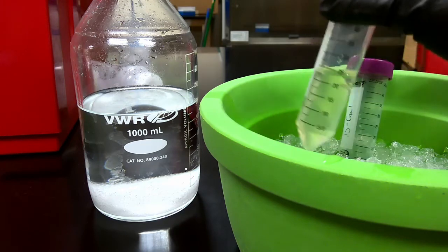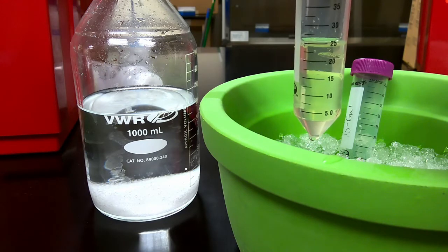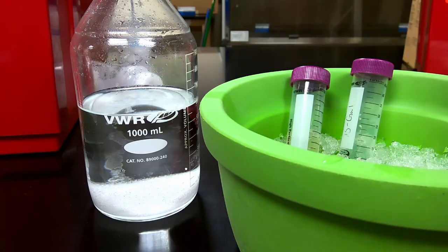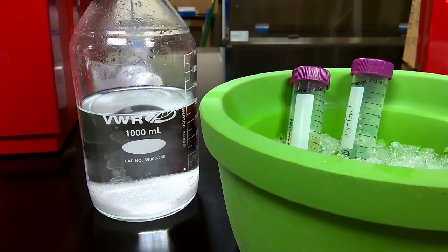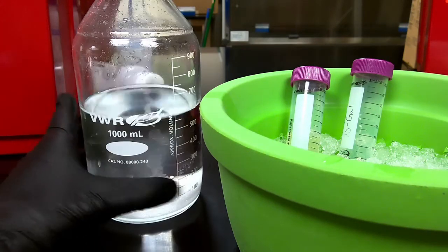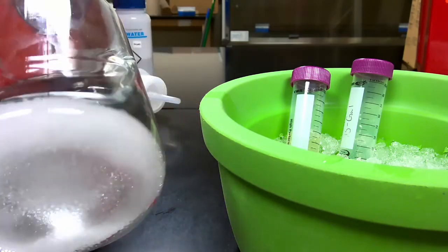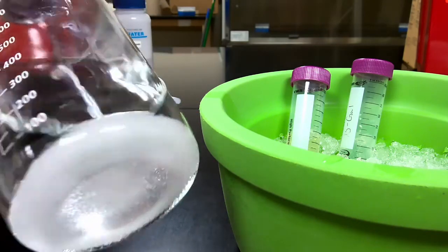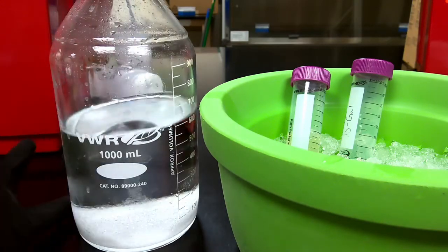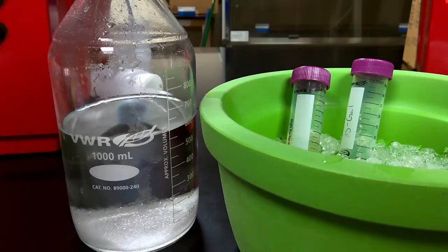And in another tube, I collected the supernatant. We got about 24. What I'm going to add to this supernatant is a chemical called ammonium sulfate. So that's what this is here. This is a saturated ammonium sulfate solution. You can tell because at the bottom of this bottle, there are a ton of these crystals, showing that the solution can no longer take any more ammonium sulfate. So for all intents and purposes, this solution is 100%.